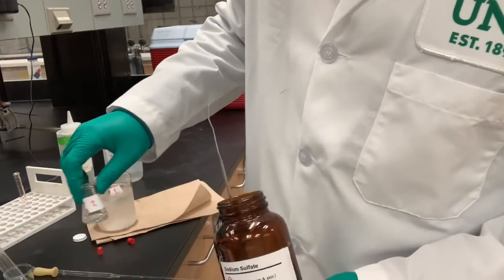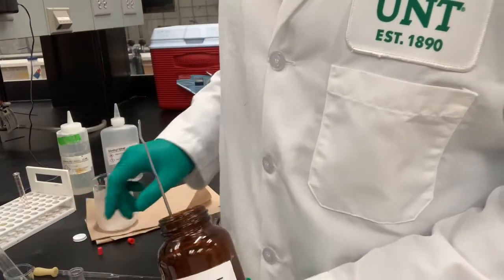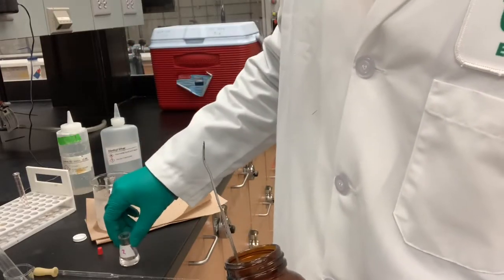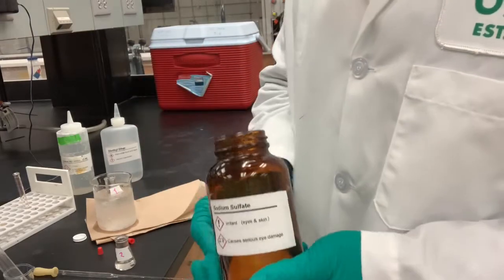Swirl it around, and I'm going to wait 10 minutes for this one, and I'm going to swirl it around every 2 minutes.